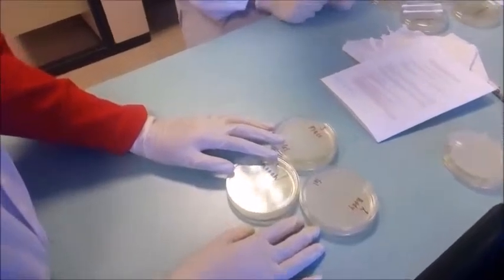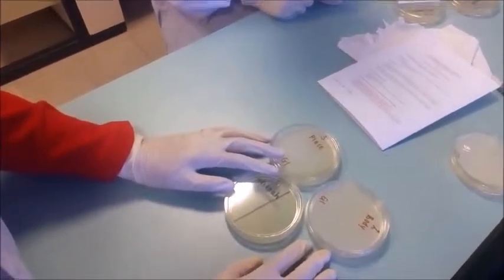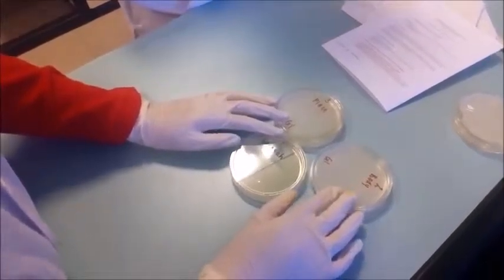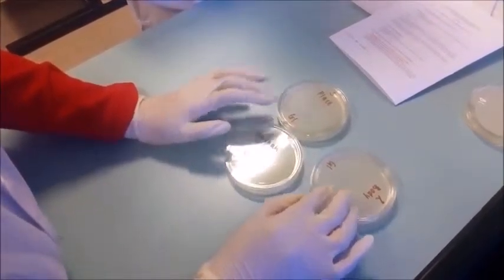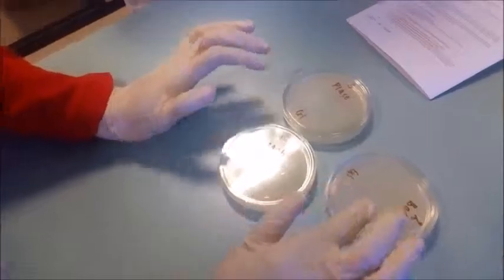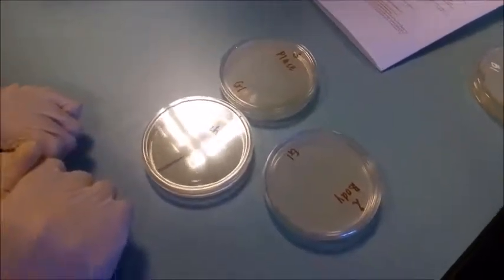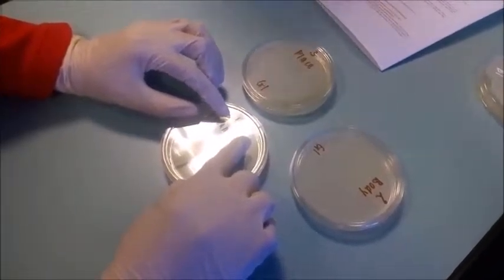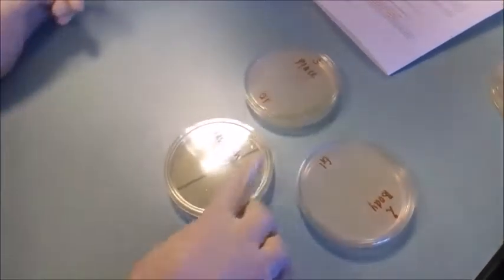Okay, now we will proceed to the experiment to determine the cleanness of part of your body, things, environment and places. Okay, this is the petri dish that has been labeled. Okay, we take 3 petri dish, which is for the first is we will identify the bacteria at our finger.